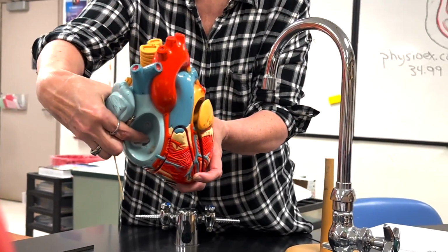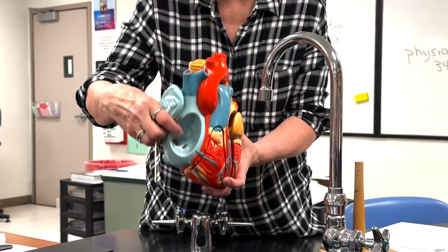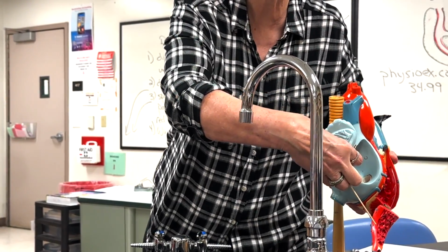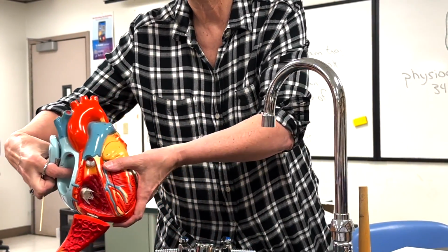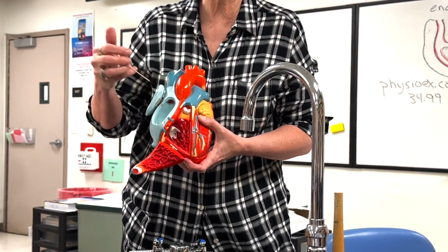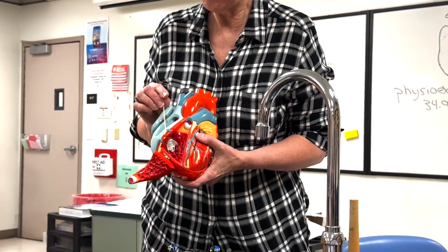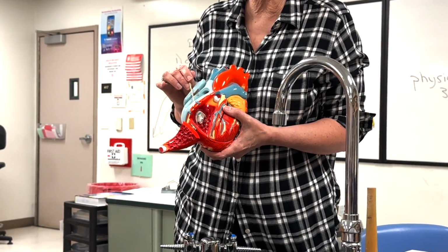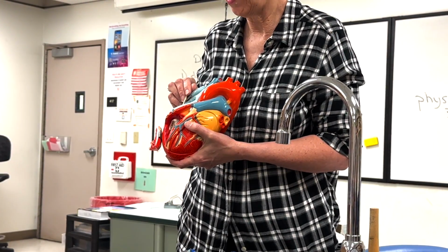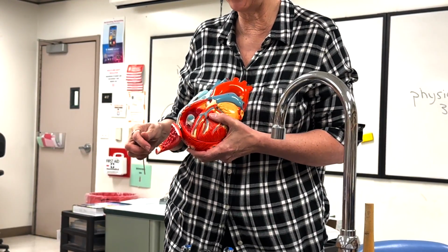Okay, it's right where the inferior vena cava comes into the heart. And there would be the fossa ovalis, which is an embryonic development structure that allows blood to move from the right atrium to the left and not go to the lungs. And we'll talk about that when we start talking about fetal circulation. Okay, blood from the right atrium when the heart is relaxed just continues to flow into the right ventricle, which is going to have a thinner wall than the left. That's one way we'll find out where we are in the sheep heart.